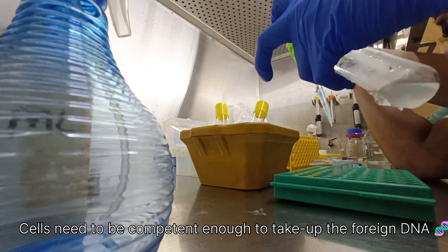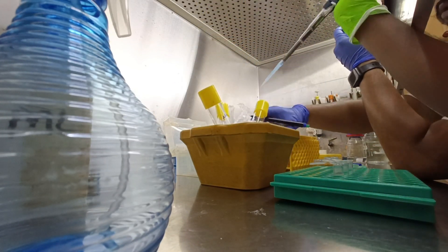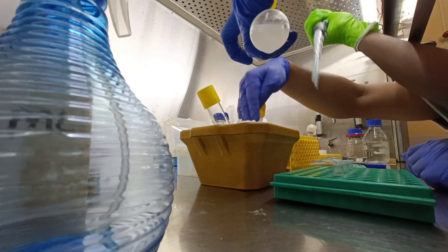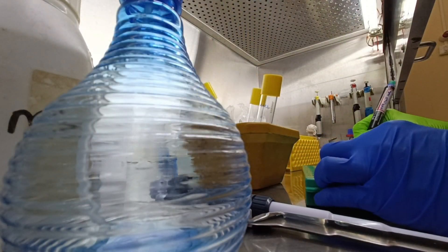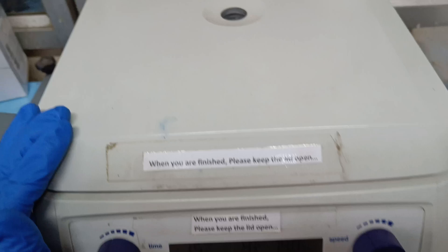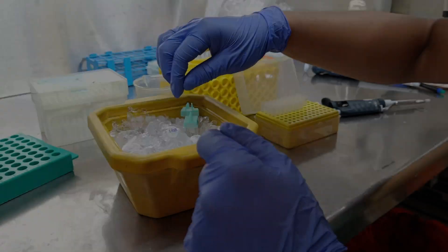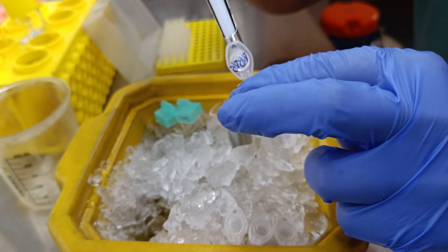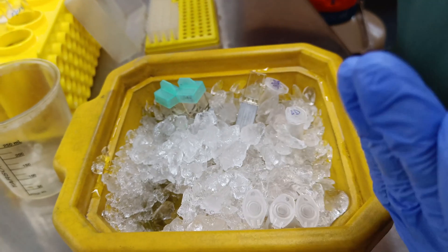Now I am taking 1 ml of each culture in Eppendorf tubes. There are a total of 3 types of strains which I am using to make competent cells. It is very important to label the names. Now I am putting them in the centrifuge at 4 degrees Celsius.